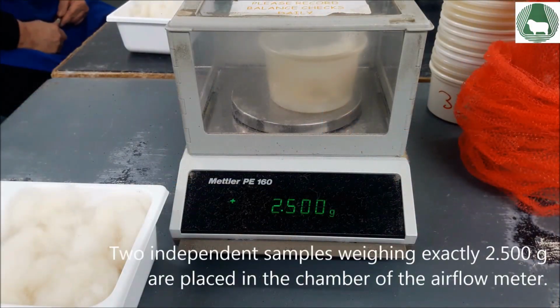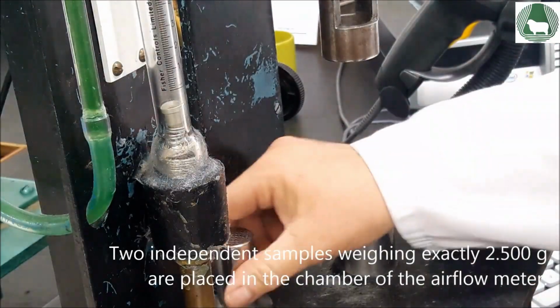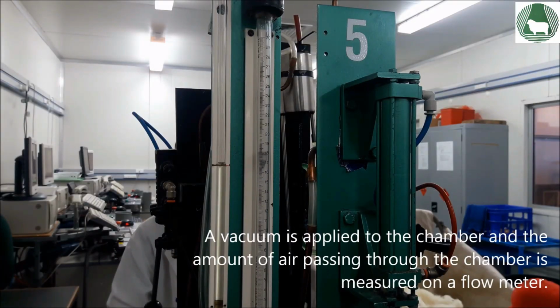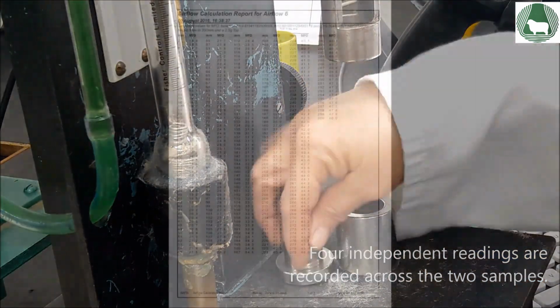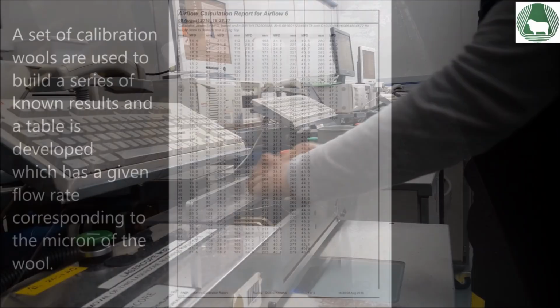Two independent samples weighing exactly 2.500 grams are placed in the chamber of the airflow meter. A vacuum is applied to the chamber and the amount of air passing through the chamber is measured on a flow meter. 4 independent readings are recorded across the two samples. A set of calibration wools are used to build a series of known results, and a table is developed which has a given flow rate corresponding to the micron of the wool.